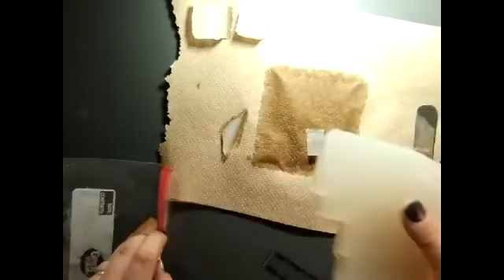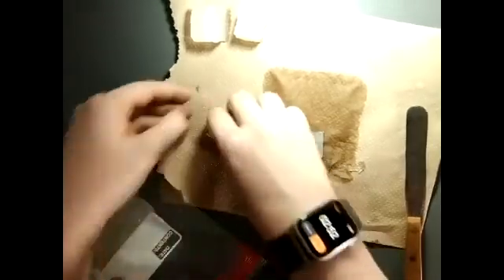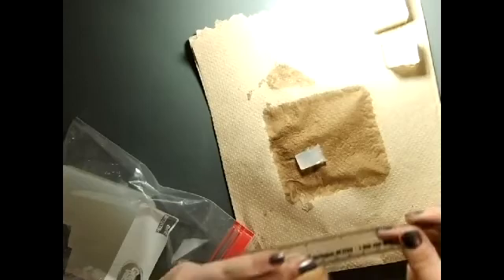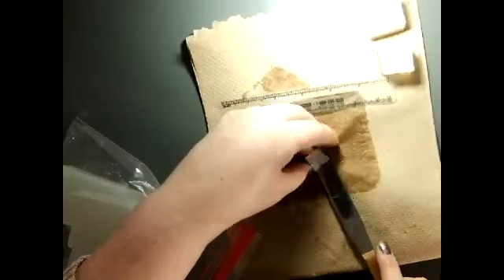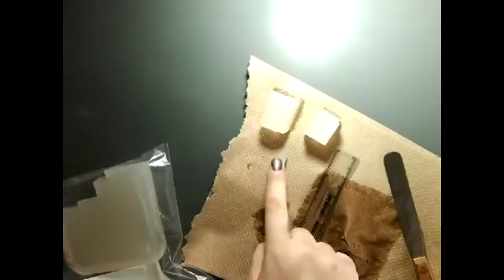That off, put this back in the bag. Little extra piece back in there. And then this is going to be too tall, so we want to cut this in half again. Put that little bit away. So those are our 3 pieces, the 3 centimeter, 2 centimeter, and 1 centimeter cube.